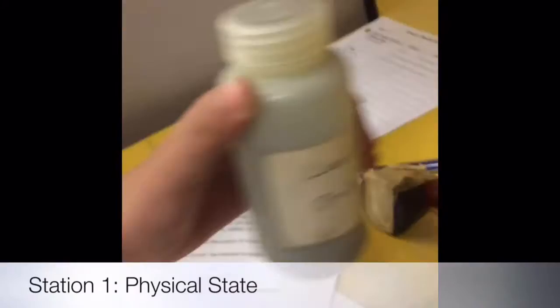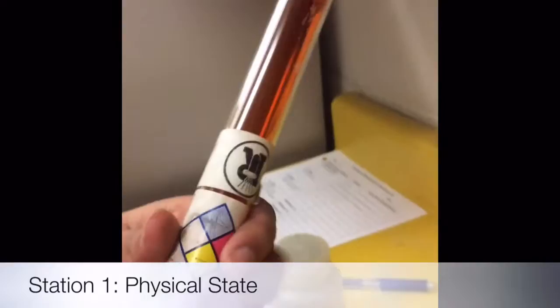Okay, so this is lead. This is denatured alcohol poison, and then this is corrosive poison.